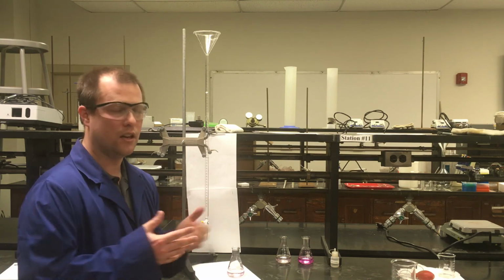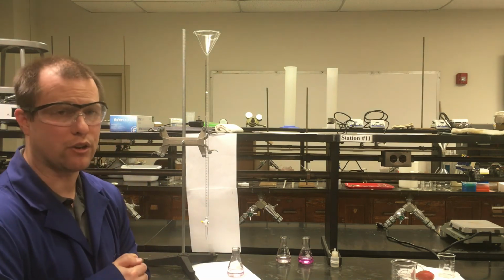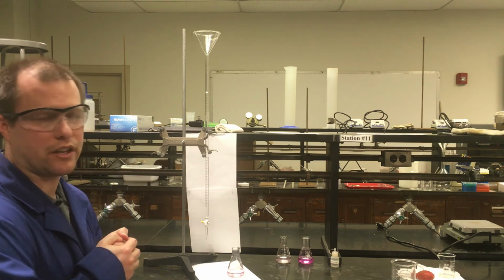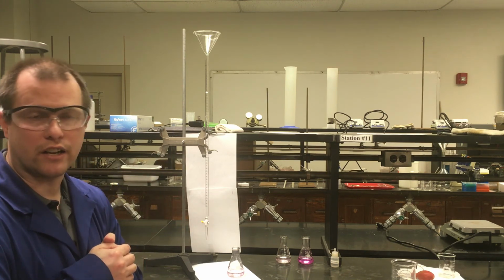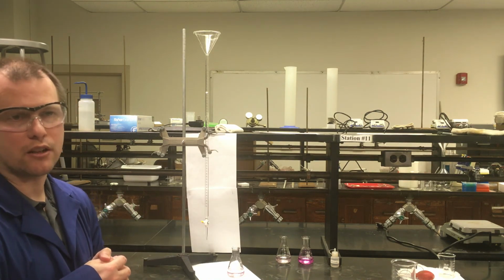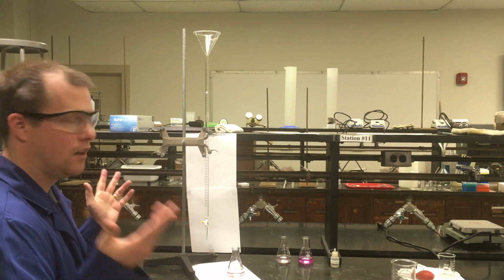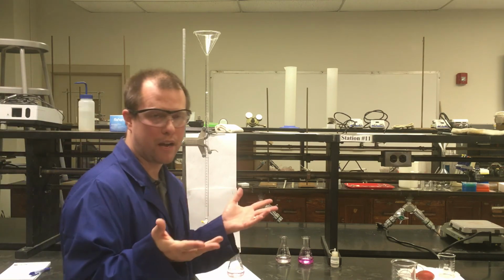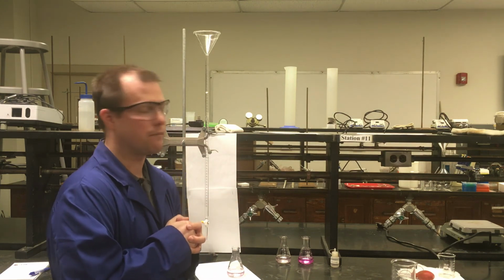A lot of titrations might require some extra caution in terms of how you get rid of them. Some of them, when you're done, you may just be able to send straight down the sink. Particularly things like HCl and NaOH, if you do a titration with those two and you don't have any phenolphthalein or other stuff there that might be a problem to send down the sink in a large quantity, then you can probably send those products down the sink. So there are instances where that might come up, but most of the time not necessary.